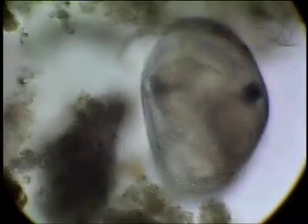Oh, very neat. And can you see some of those little crustaceans moving around, Jeff? Yeah, I hope I can. That's neat. It's sort of funny though with this one, like the other ones, I could see an object, and when I focused, it was perfect on that object. But in this one, it seems like I can focus on one thing, and then if I move the thing, it focuses on another thing. Why is that? Yeah, that has something to do with what's called planes of view.